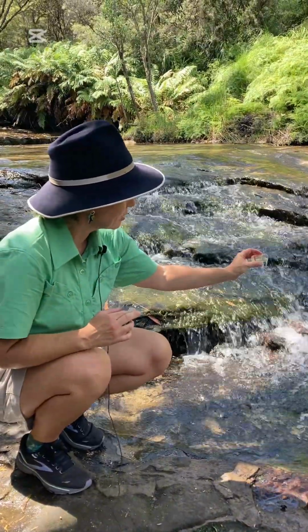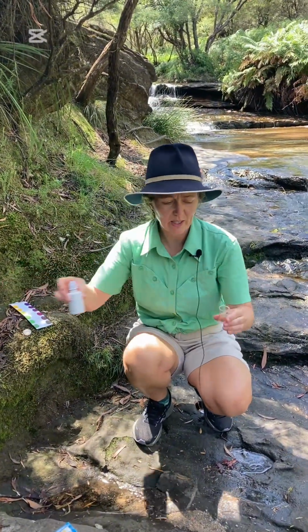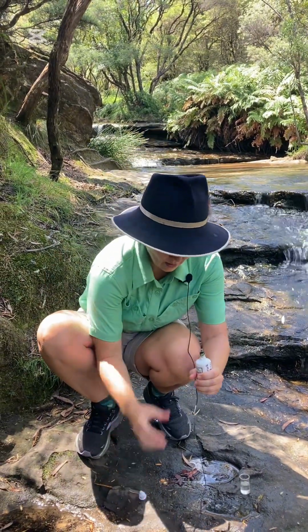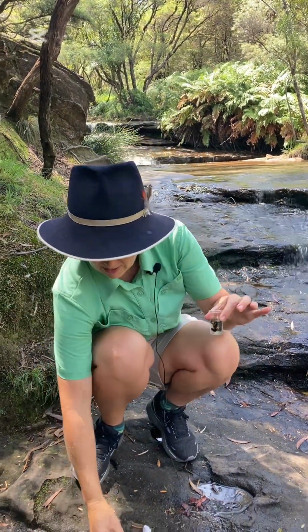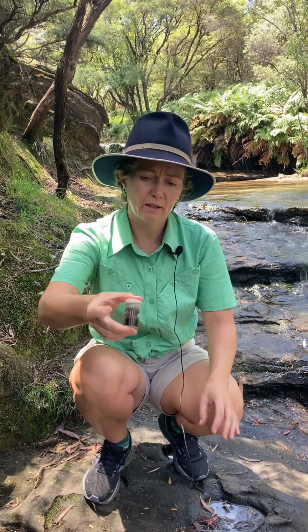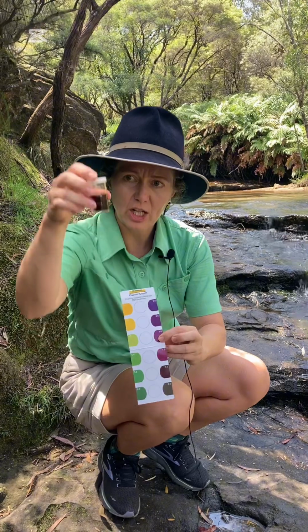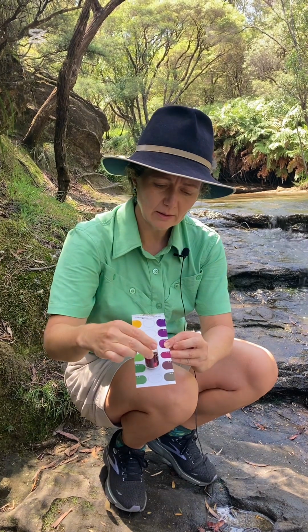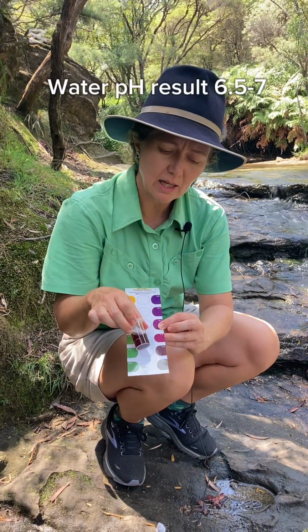halfway, 10 mils, and then I'm going to take the universal indicator solution which comes in the kit, and I'm going to put 2 drops of that, 1, 2, into my sample. I'm going to put the lid back on, just gently invert it, and then compare it to the colour change chart. You can see that it's quite a deep purpley, almost brown colour. So I would say that it would be somewhere in between 7 and maybe even 6.5 in pH.